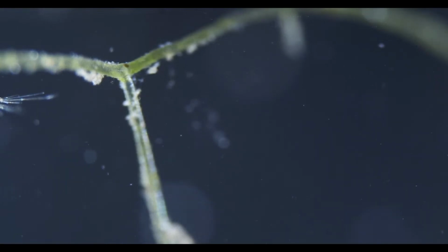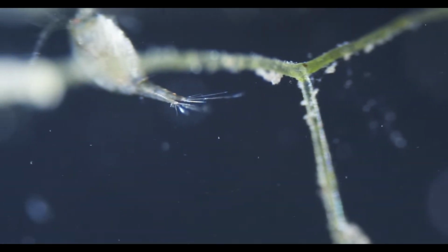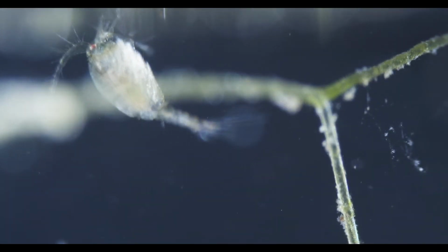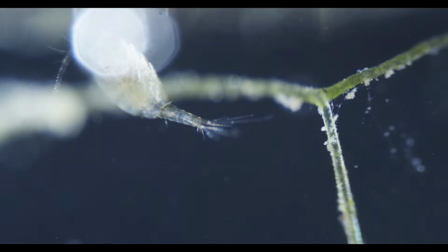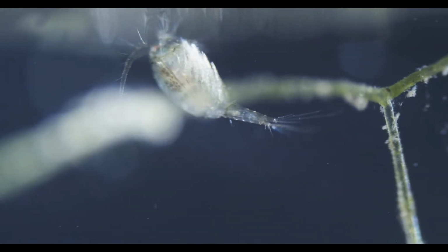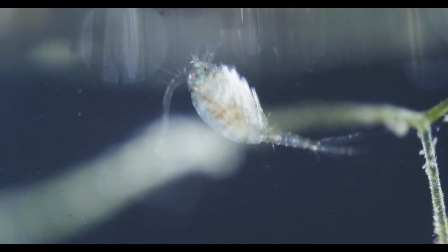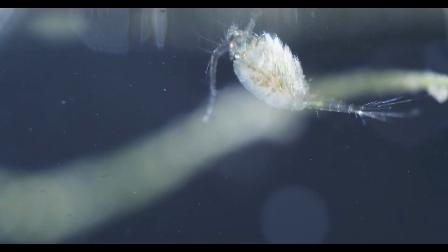I just assume fairy shrimp, clam shrimp, and tadpole shrimps are similar looking. There are other crustaceans, of course, it's just that they are quite rare, as far as I know. I don't get them. I know there are some places in the US where they are more abundant.